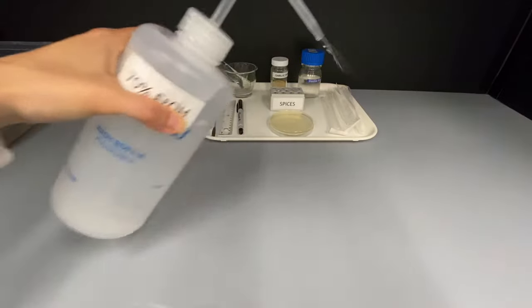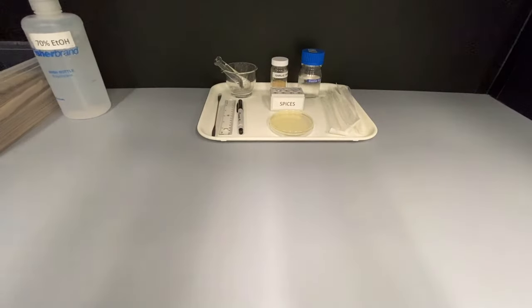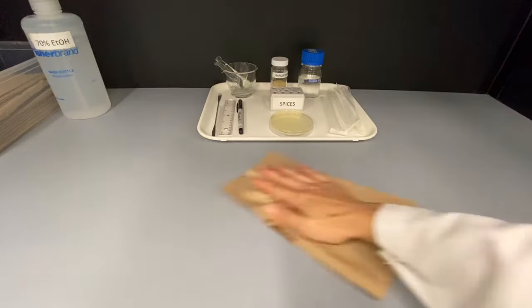Today we'll be investigating how spices affect bacterial growth. The first step is to make sure you wash your hands and then wipe down your bench with 70% ethanol.